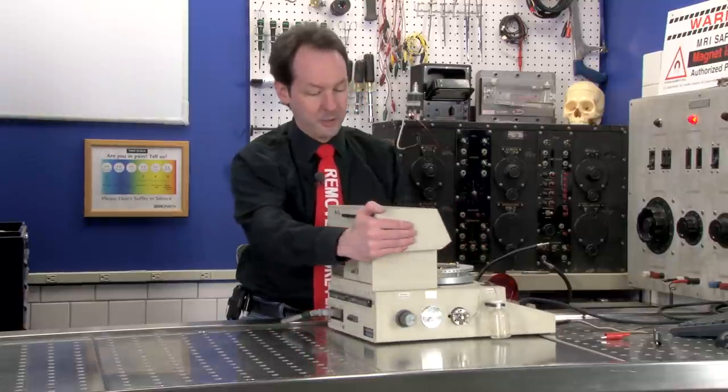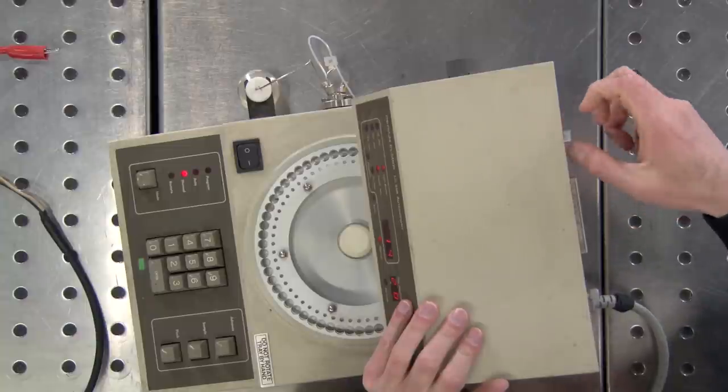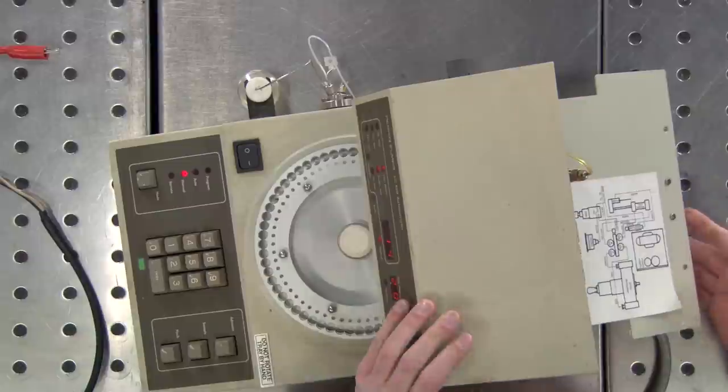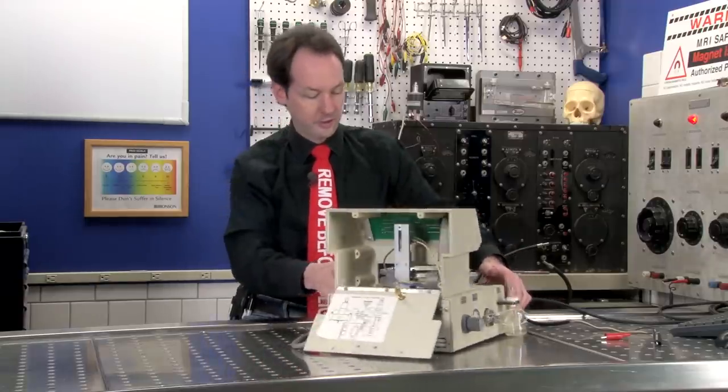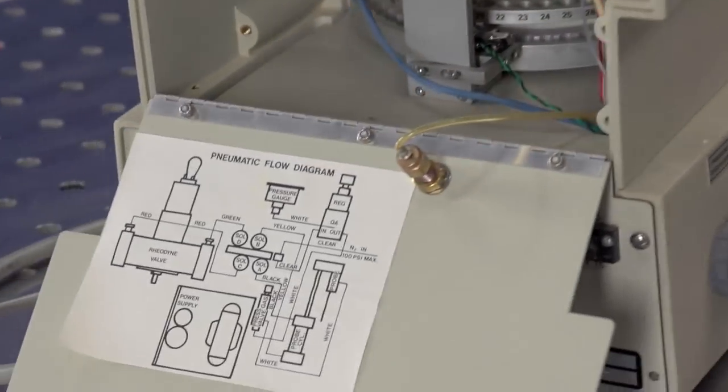And I'm going to begin with the back because there's a couple of thumb screws which make this relatively easy to open. Oh wow, this is neat. Here, I'll turn this around so you guys can see. There's stuff going on in there.